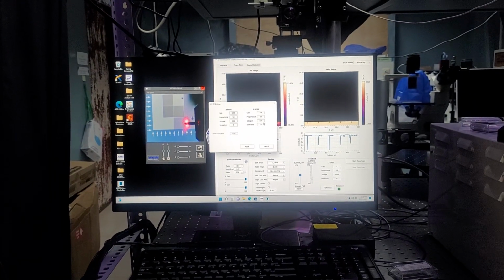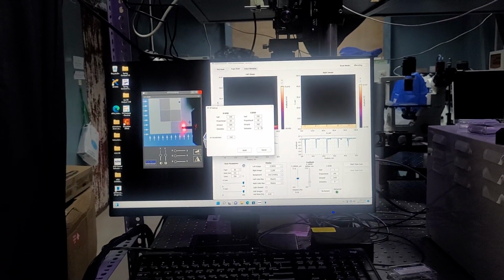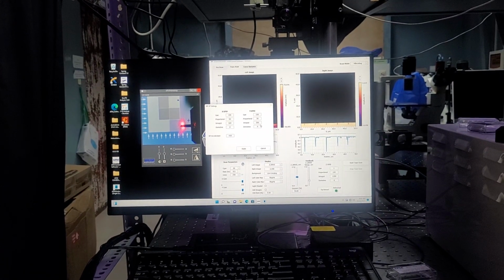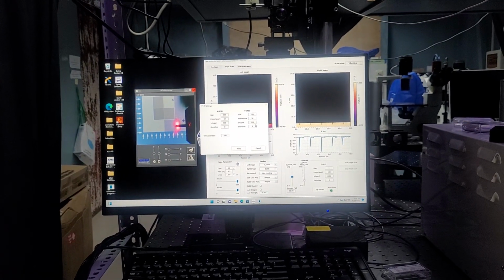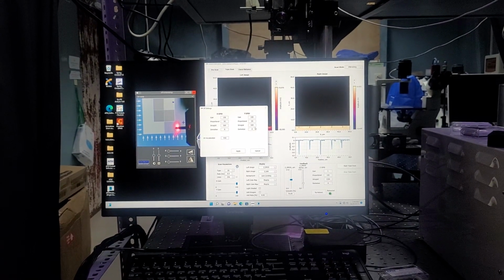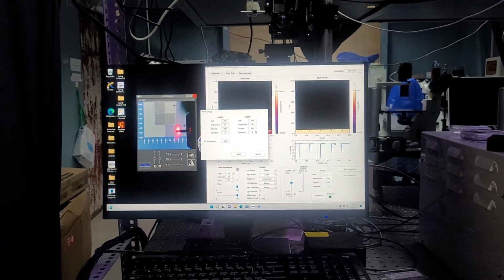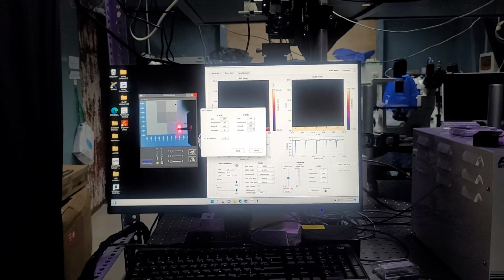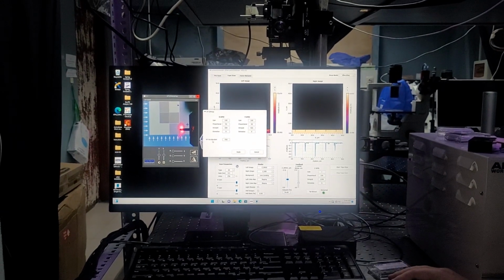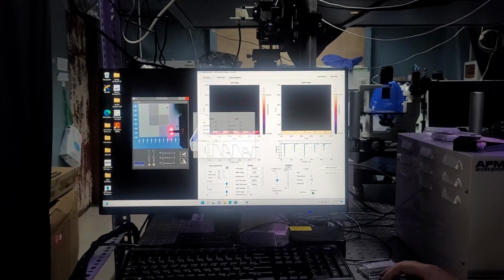Typically, if you're scanning 5 microns by 5 microns or bigger, you don't need to adjust these values. As soon as you start going below that 5 microns by 5 micron size and smaller, then these values will need to be adjusted, because then the noise that those strain gauges create will become noticeable and it will look fuzzy. Additionally, XY acceleration should stay at 450. You shouldn't need to adjust that.